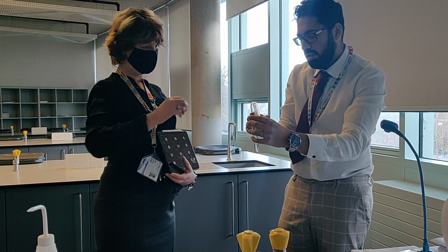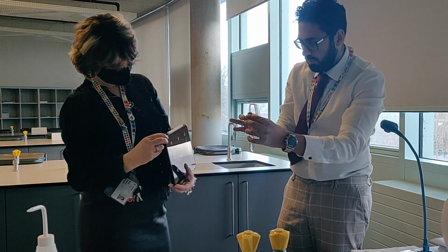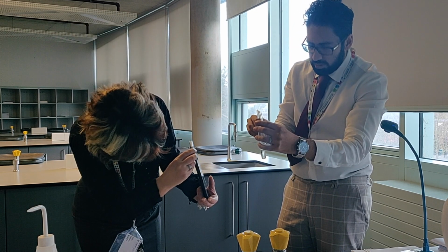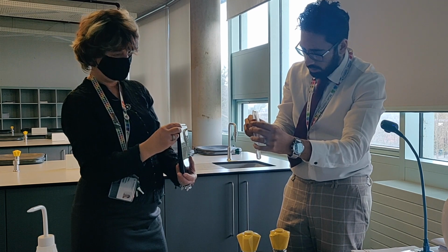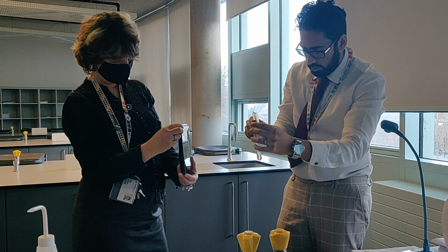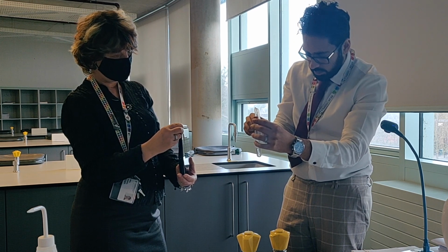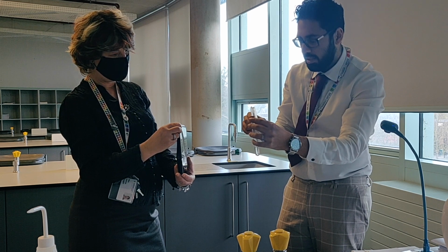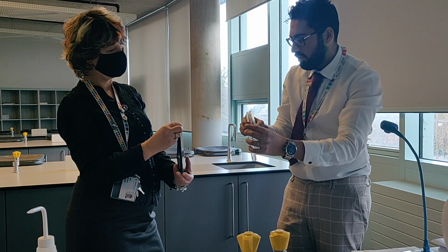But because of the fact this one you need to do very quickly. If you don't do it quick enough, then carbon dioxide will escape and not be seen. And you see, it is turning slightly cloudy. It's slightly starting to change colour. I don't know if you guys can see it on the camera. It's quite hard to see, but it is definitely changing colour slightly. So there are little bits of carbon dioxide being produced, but as I said, this one needs to happen quickly. Otherwise, carbon dioxide is just going to escape out the top of the test tube.